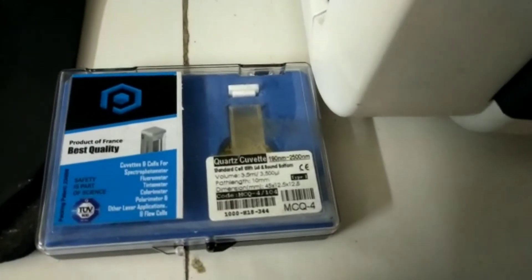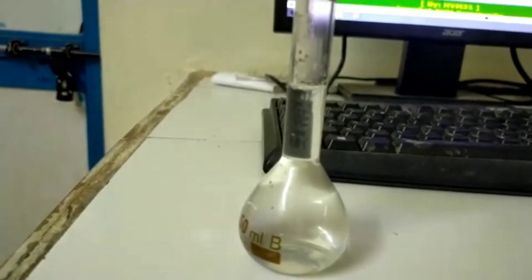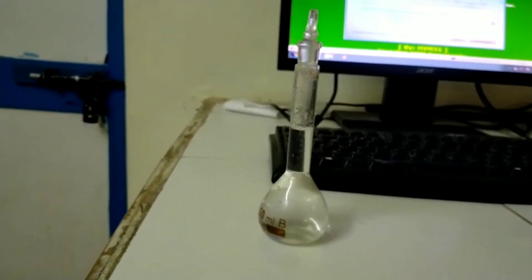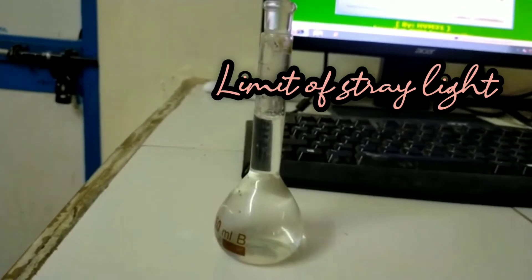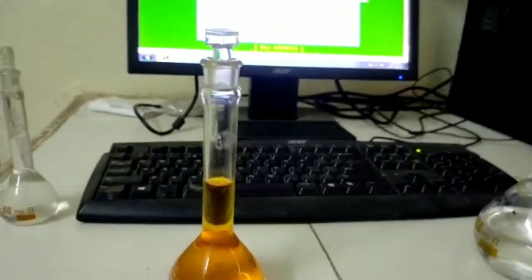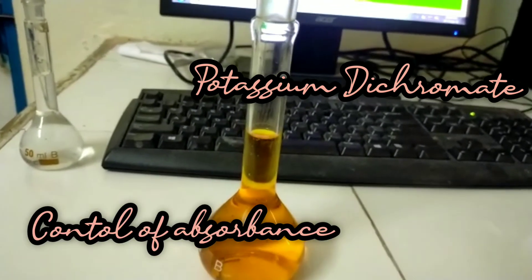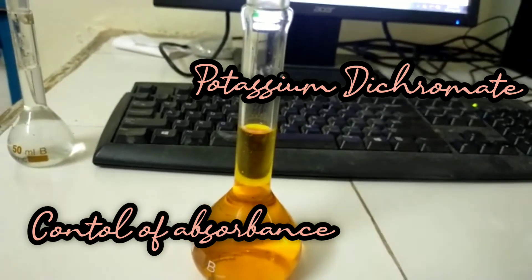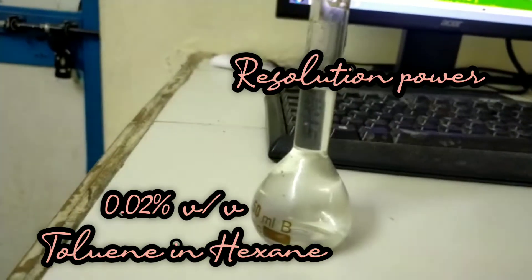We can calibrate the spectrophotometer using these solutions: a 1.2% weight by volume solution of potassium chloride in distilled water for limit of stray light; a potassium dichromate solution where a weight between 57 mg to 63 mg is weighed and dissolved in 0.005 molar sulfuric acid to produce 1000 ml; and a 0.02% volume by volume solution of toluene in hexane.